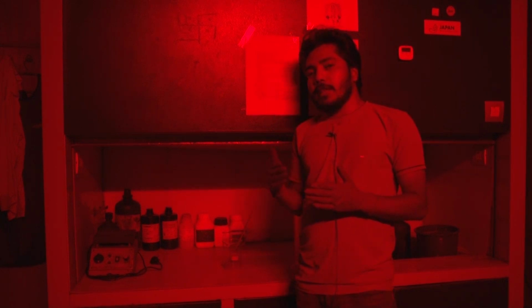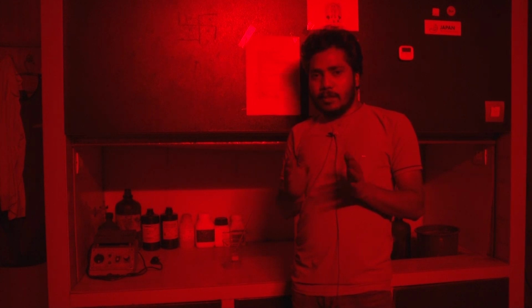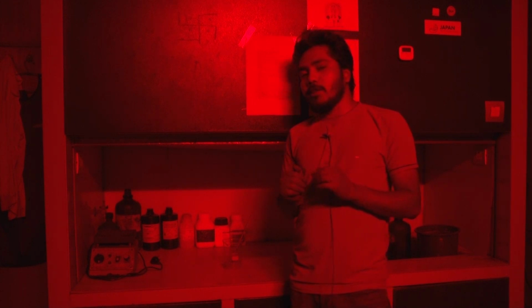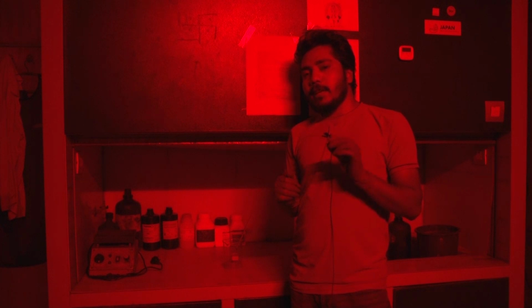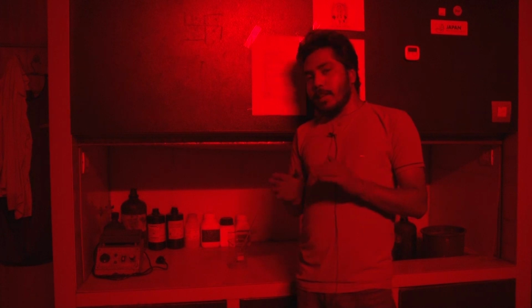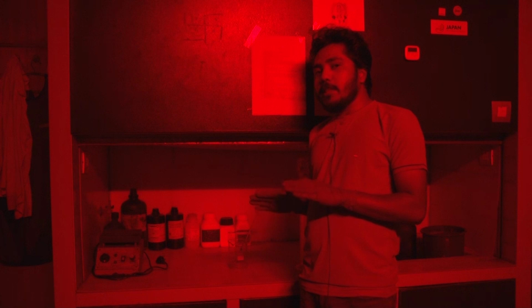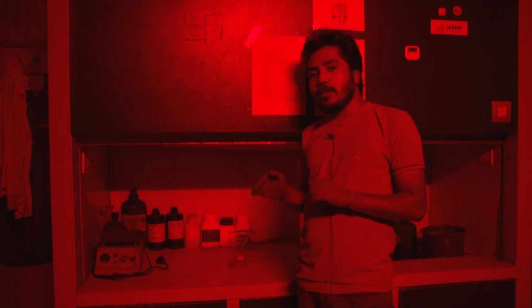In coarse grain, basically 63 micron to 250 micron is used, and we use the central part of this size range of quartz mineral. For your reader, we are using 90 to 125 micron here in this lab, because our instrument is calibrated with this grain size only. So today we will basically focus on the coarse grain quartz dating technique part.